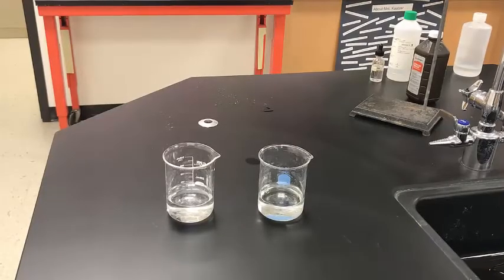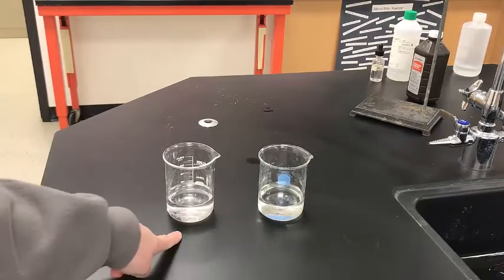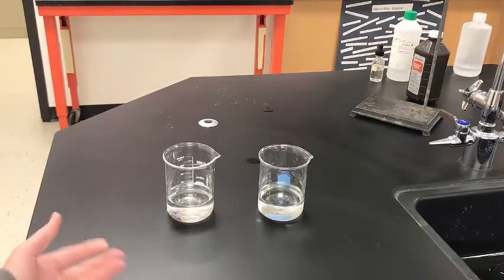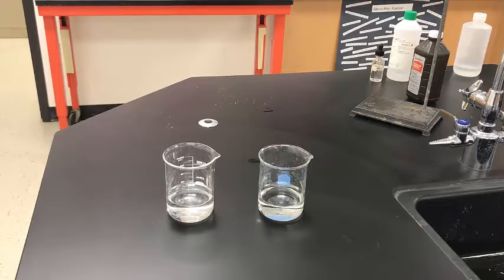Okay, time for our last lab. So lab 4, you're going to be looking at the reaction of an acid and a base. So we have our acid here and our base here. They're both clear liquids. They both look like water, but they're both not water. All right. Anyway, so one is hydrochloric acid, and the formula for that is HCl, and then the other one is sodium hydroxide, and the formula for that is NaOH.